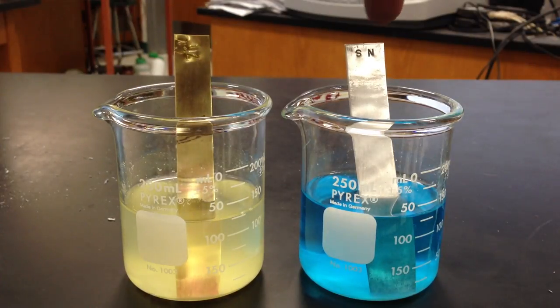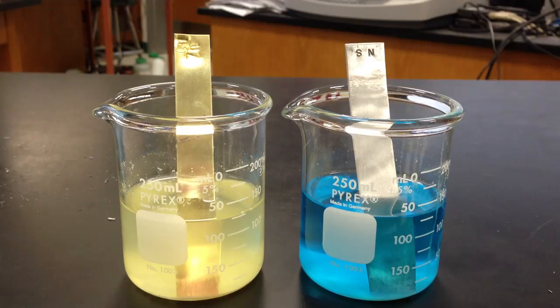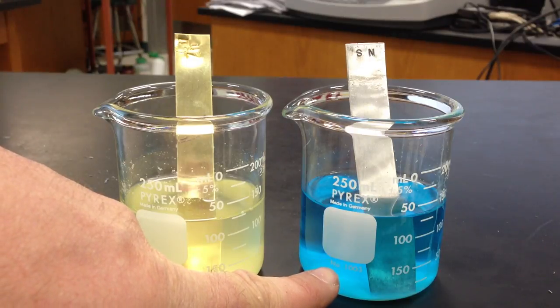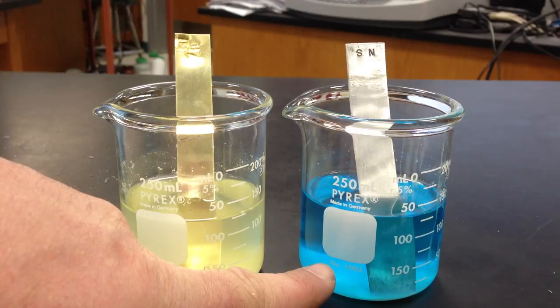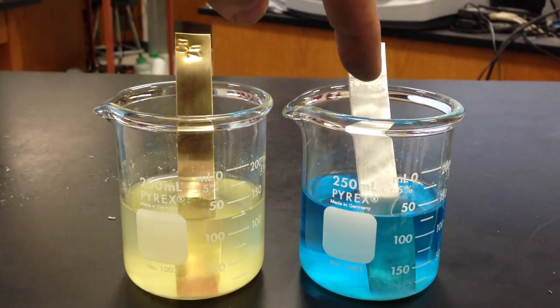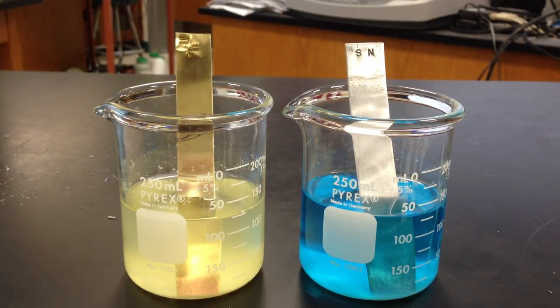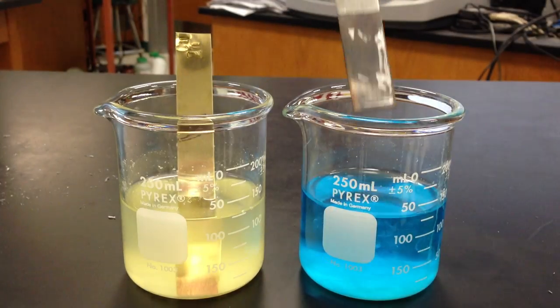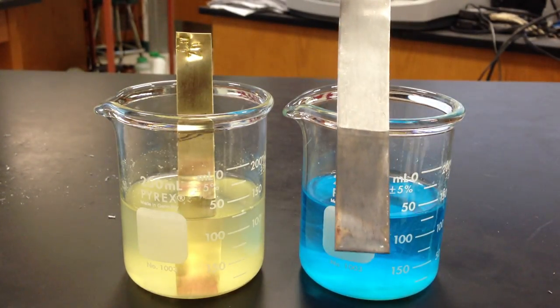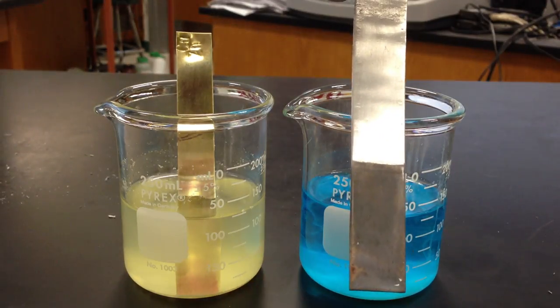If you look to the right beaker, I've got my tin sitting in my copper chloride. From our net potentials, this was a positive voltage, meaning there was a pathway — a potential difference for electrons to flow, because the copper 2+ was strong enough as an oxidizing agent to pull electrons from the tin and become reduced into copper, or the tin was good enough to push its electrons onto the copper. Either way, the combination gave us positive volts in our net potentials, resulting in a spontaneous reaction. We can see the copper plating onto the tin, showing the forward reaction did go — electrons were passed, and we got a positive voltage.